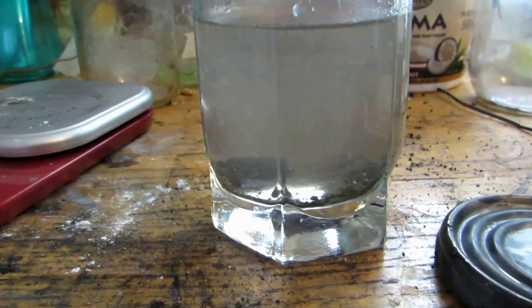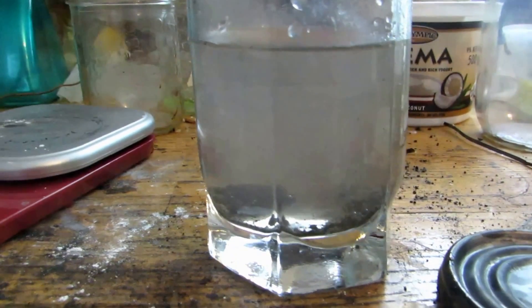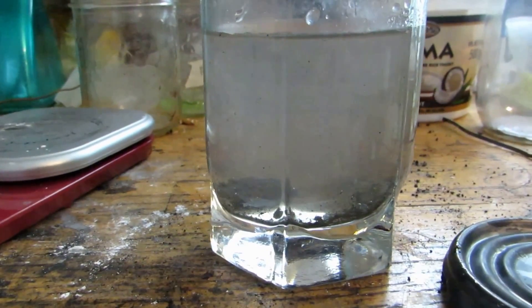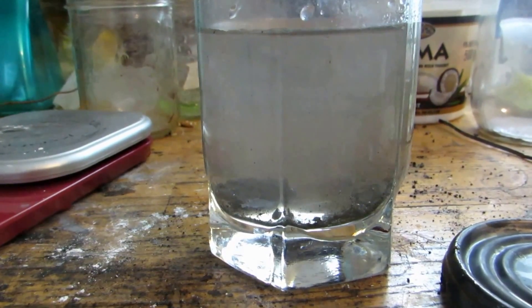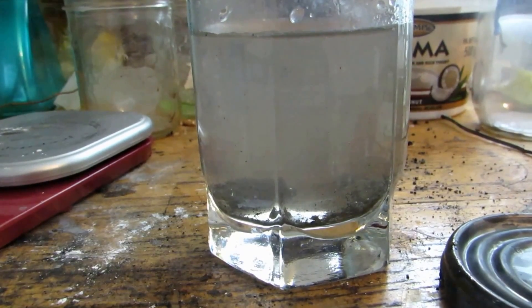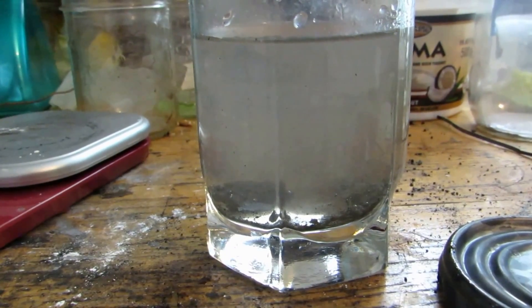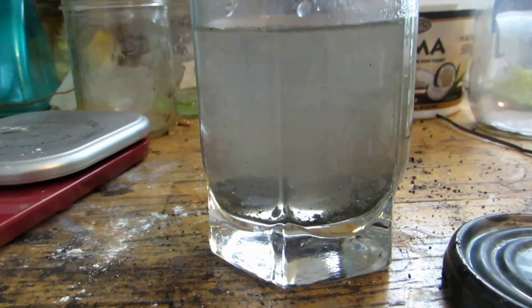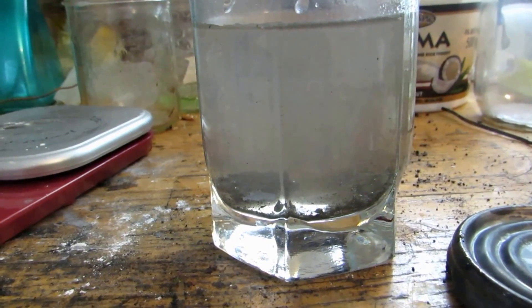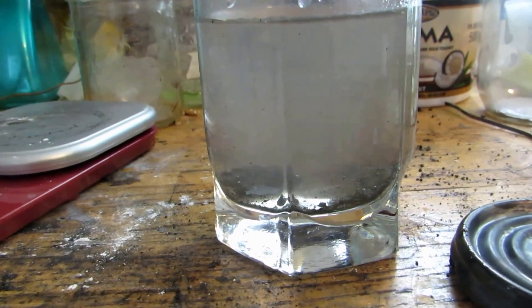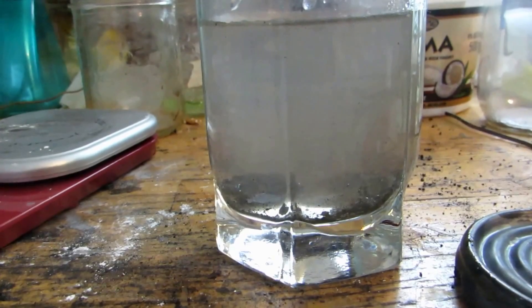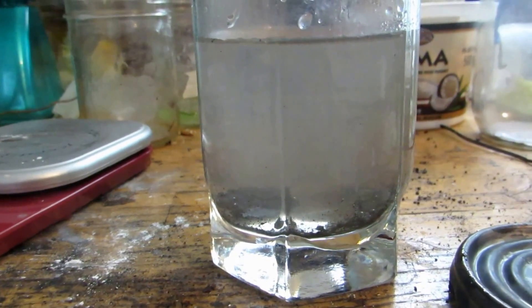Because while there's a vacuum, there's actually no air. And because there's no air, it can't oxidize. You can get much larger chunks which react a lot more vigorously. And now, I will repeat that process and get a larger sample, which I might show in a future video. But I'm actually going to make a video first on how to make a vacuum electrolysis setup.